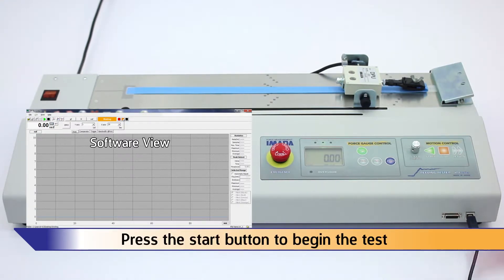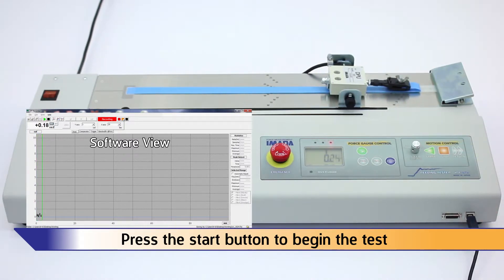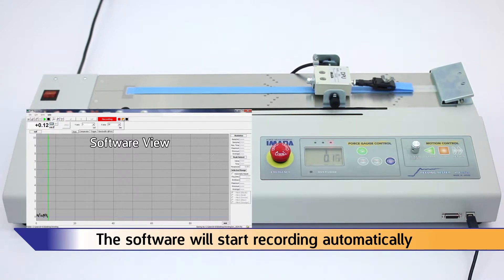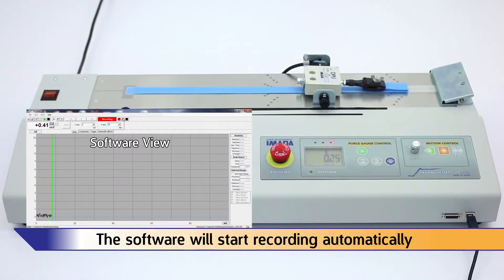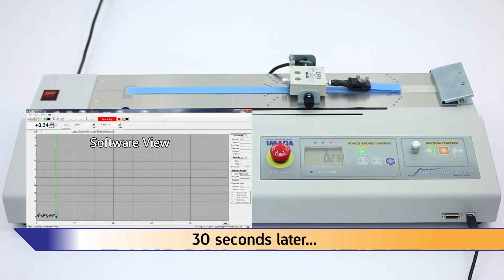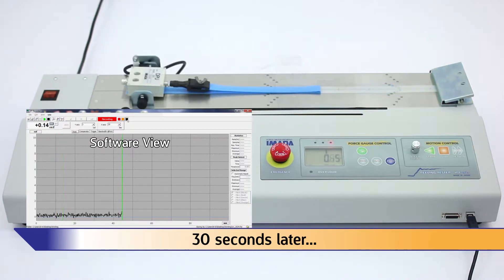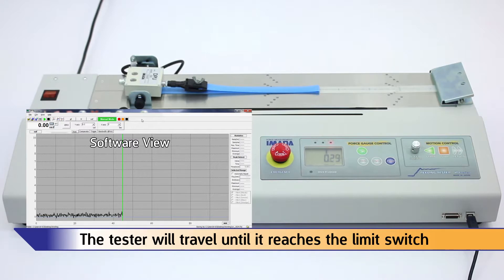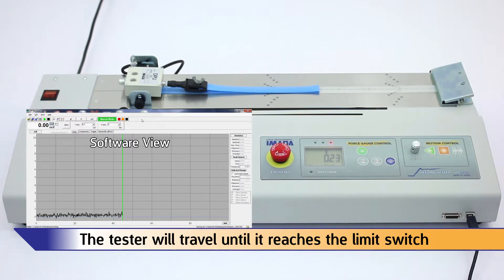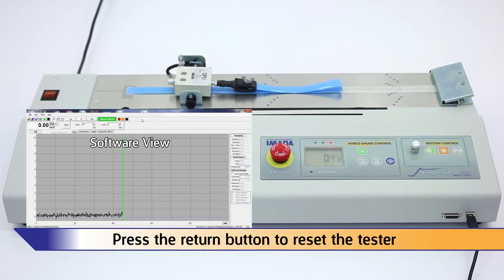Press the start button to begin the test. The software will start recording automatically. The tester will travel until it reaches the limit switch. Press the return button to reset the tester.